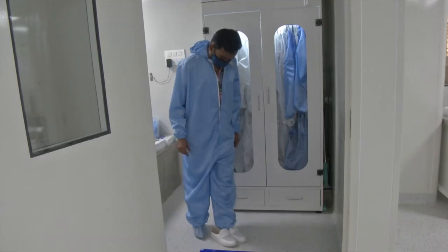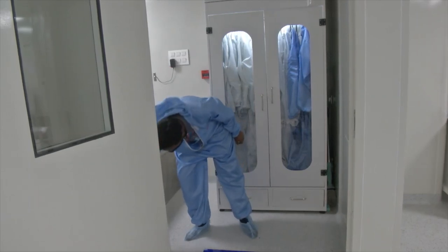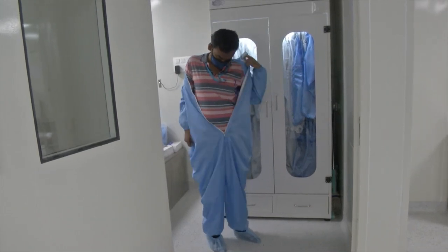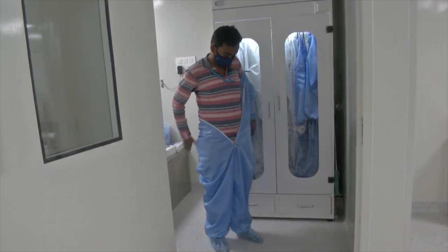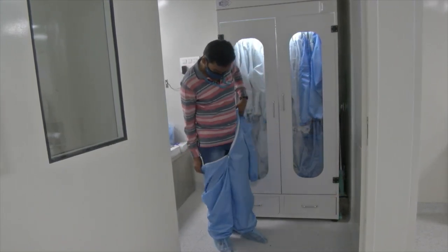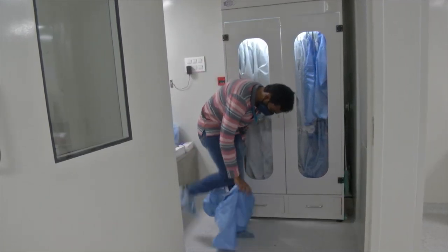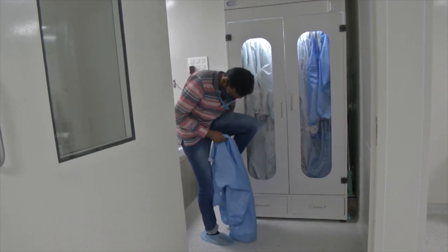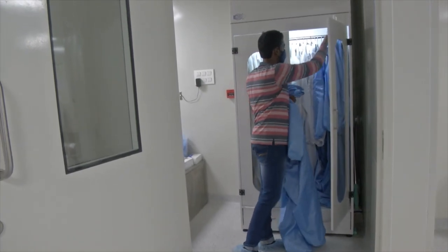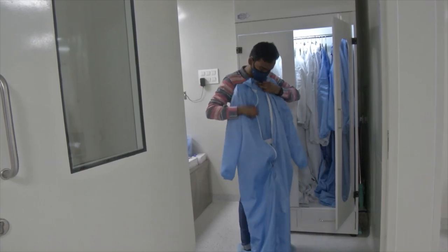The next step is to remove the clean room gown. Clean room gowns should be worn by a single user — the same gown should not be worn by another user, and it should be placed at a designated place from where it was taken. These are clean room disciplines required to maintain cleanliness and prevent cross contamination, which is one of the major causes of device failure in a clean room environment. As we can see, the gown is being placed at its designated location.